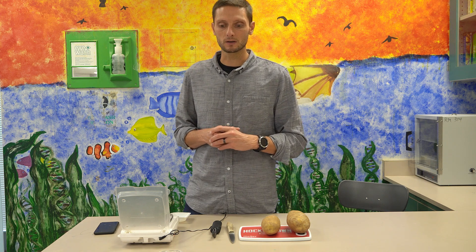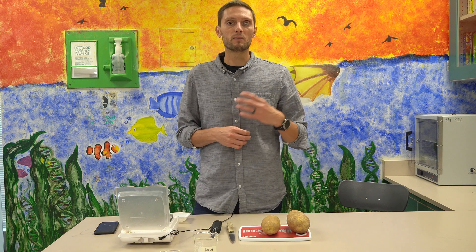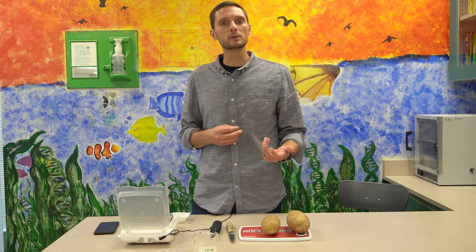We'll take chunks — or cubes — of potato and place them into different salt molar solutions, such as 1.0 molar. We'll let the cubes sit for 48 hours, measuring mass before and after to see how it has changed. This will help us identify solutions that represent hypertonic, hypotonic, and isotonic conditions relative to the potato, and help us understand why donor organs must be transported in very specific conditions to survive.